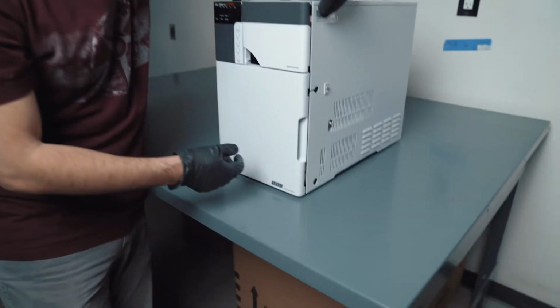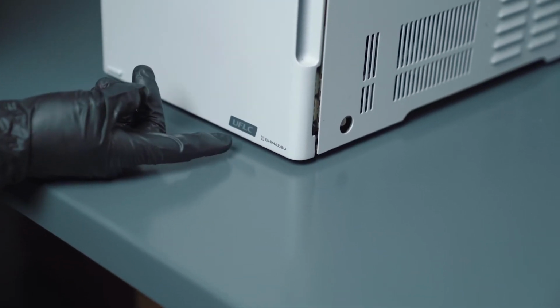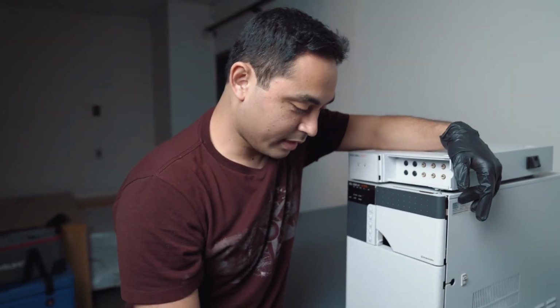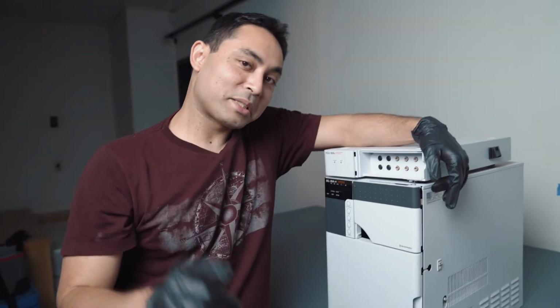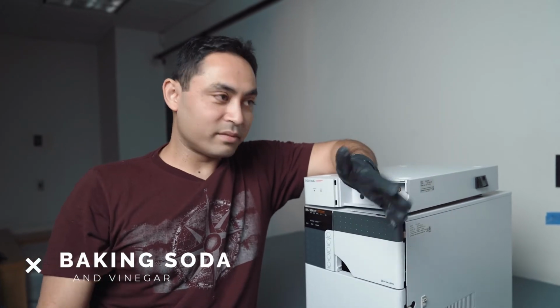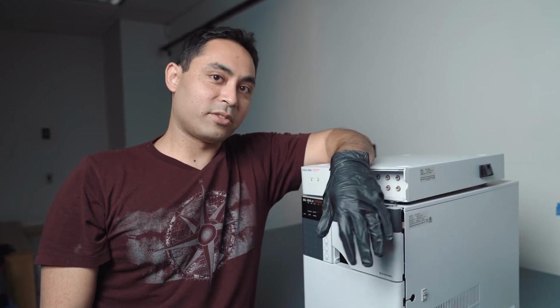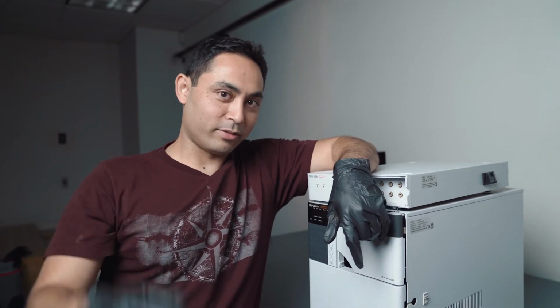Team, bonus content, pro tip. The feet that Shimadzu uses, I think they're made out of Sharpie markers, but they leave black streaks everywhere. The best way to clean those up, I find, is baking soda and vinegar. Otherwise, nothing else really gets it out too well, but surprisingly, baking soda and vinegar, non-toxic, does a super great job cleaning those up. You'll thank me for that one. I got you. You owe me.